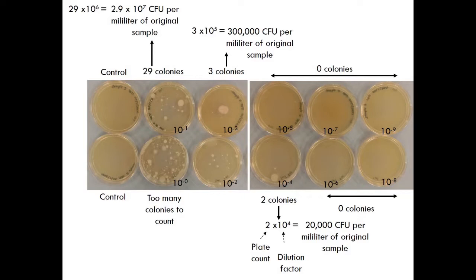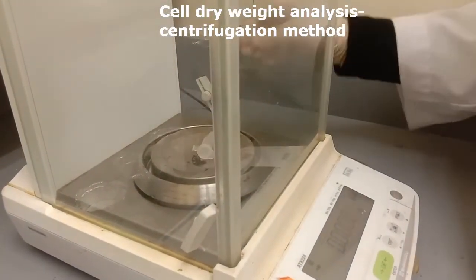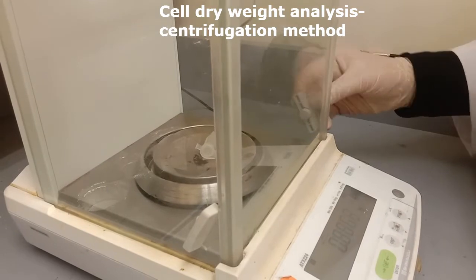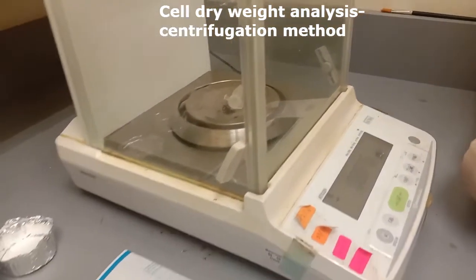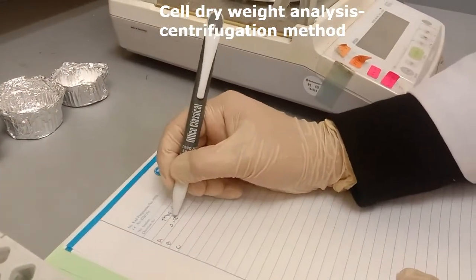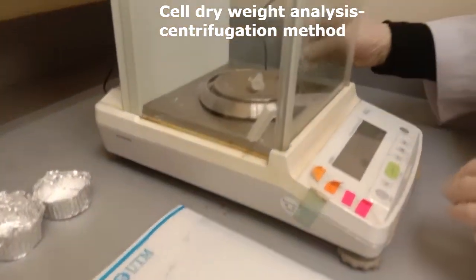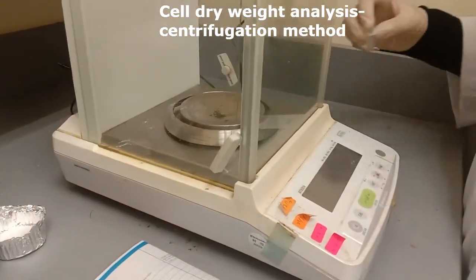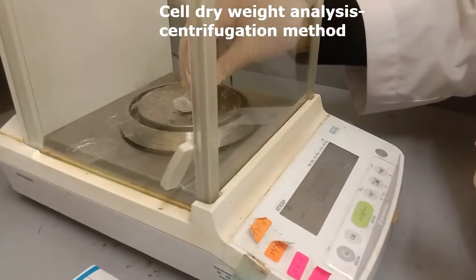Here we will be showing you how to do cell dry weight analysis and optical density analysis for the bacterial growth profiling. There are two methods for cell dry weight analysis, the centrifugation method and filtration method. For the centrifugation method, first we must record the weight of the empty microcentrifuge tubes that will be used in the experiment.